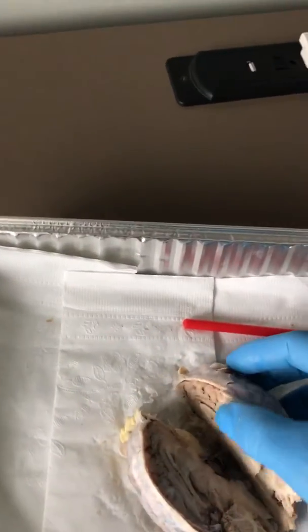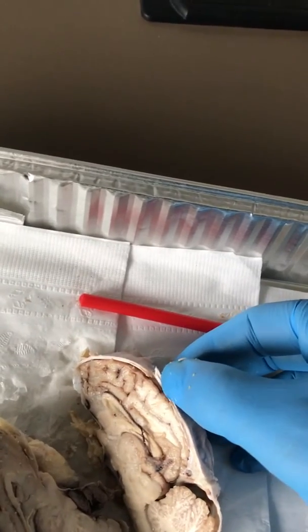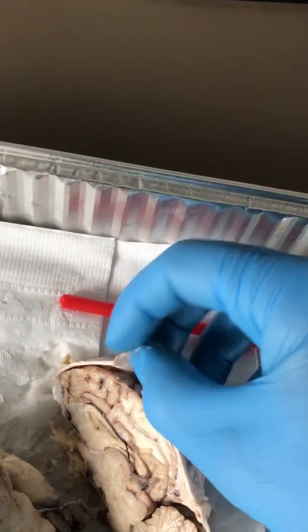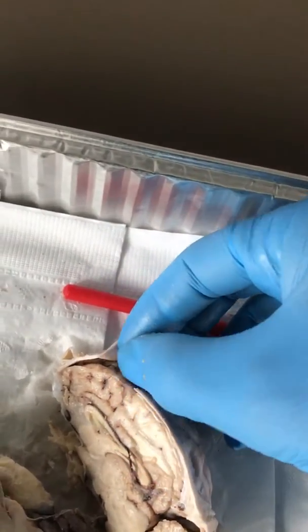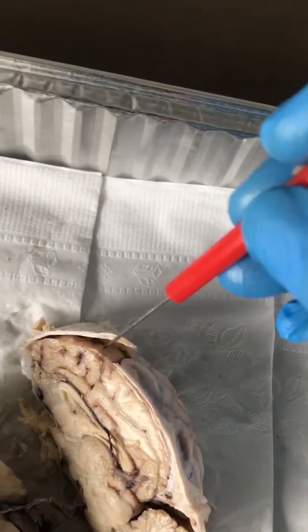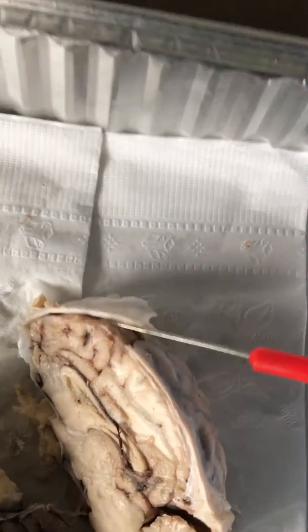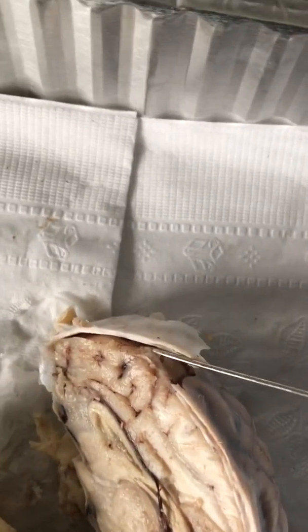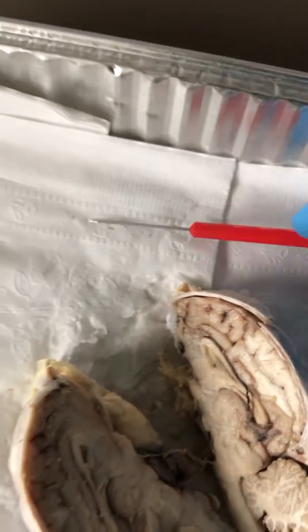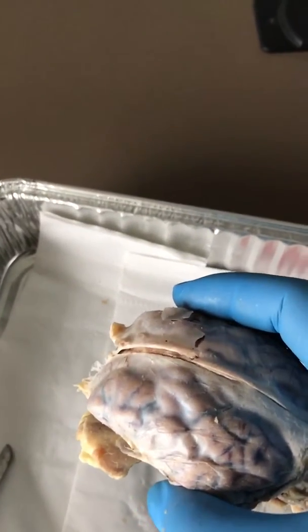Meninges. So I've split them down, but as you can see, it starts with the dura mater and then goes into the arachnoid, and then the pia mater actually covers up here. It's really hard to get to, but you can definitely see it as I poke it with this. I can kind of lift it up, and that right there would be the pia mater that covers the gyri and sulcus and all of that. And all of that helps form the blood-brain barrier, blood-brain system.